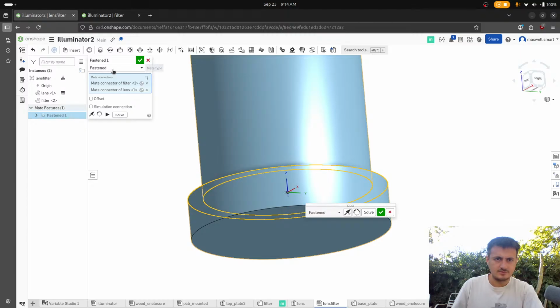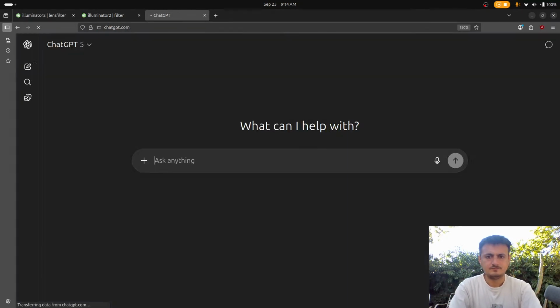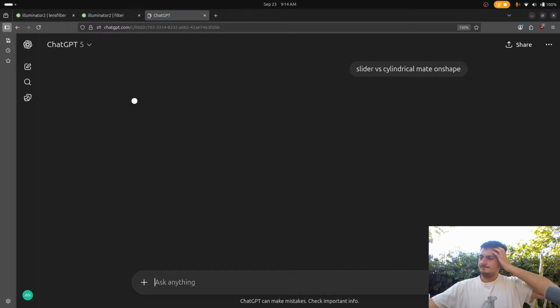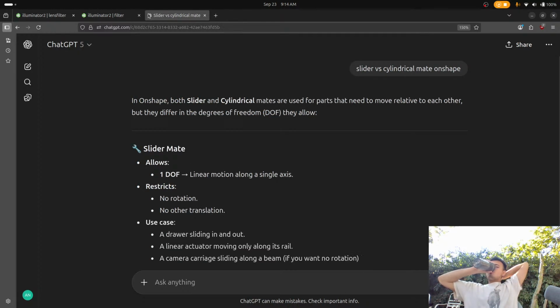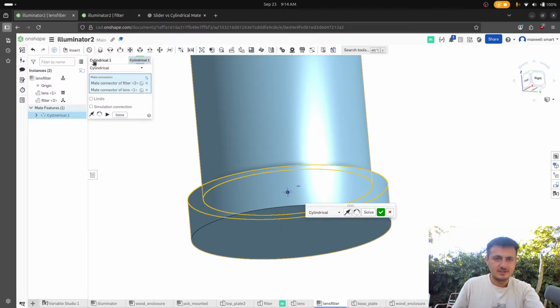Except instead of a fasten mate, we want it to be, what is cylindrical mate? Oh yeah, see that's good. What would slider do? What does slider do? Wait, what's the difference between a slider and a cylindrical mate? Oh really? I didn't see it rotate. Okay, that's fine. Let's make it a slider mate.